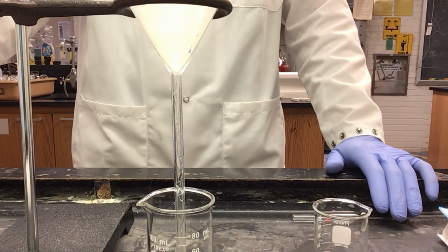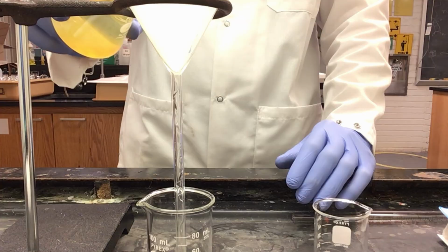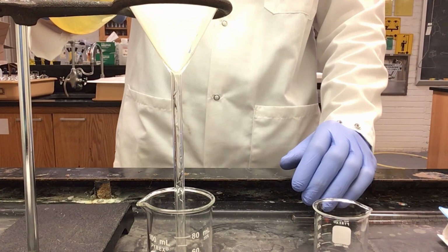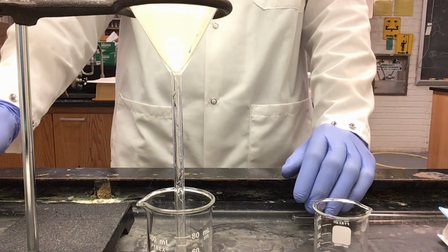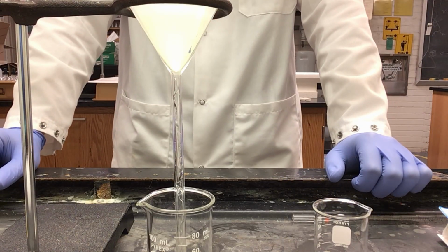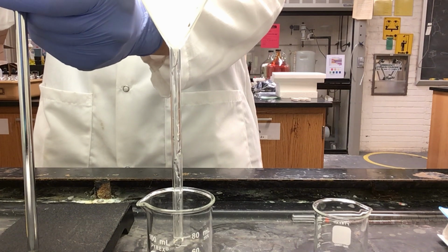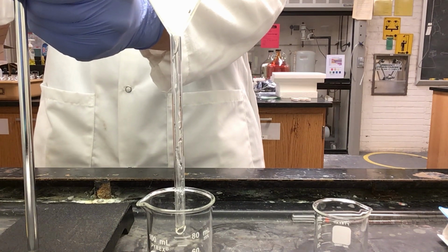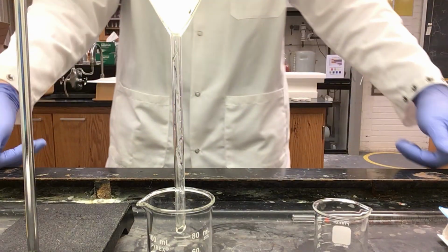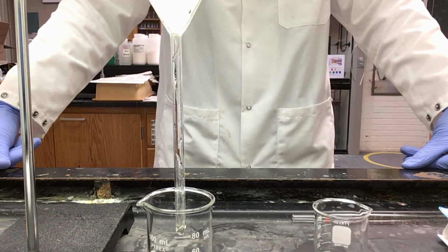With this part, I now just need to keep going back with my stock solution, filling up the funnel. I do not want to fill the funnel beyond the capacity of the filter paper, so this is going to take some time to slowly drain. As I go, I will need to raise the funnel up in order to make sure that I do not overfill my beaker or dip the neck of the funnel into the beaker.